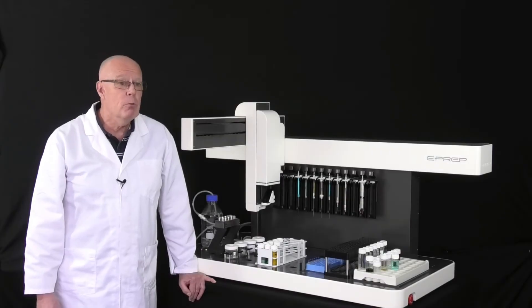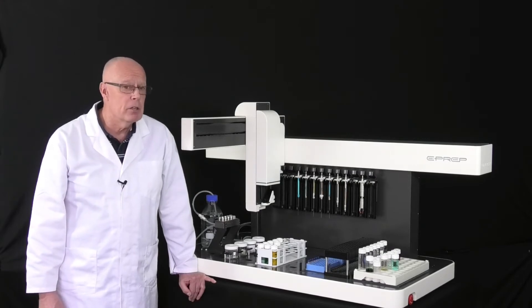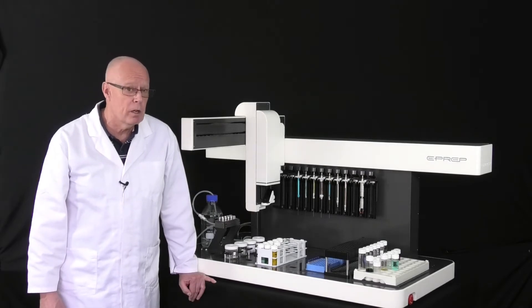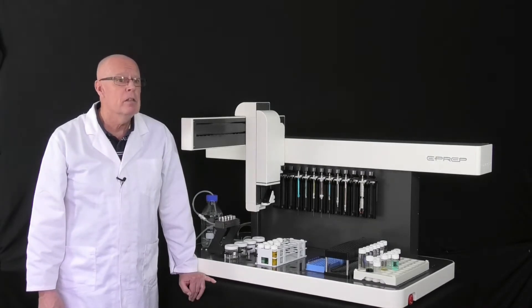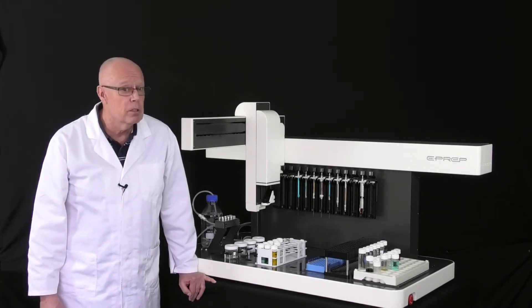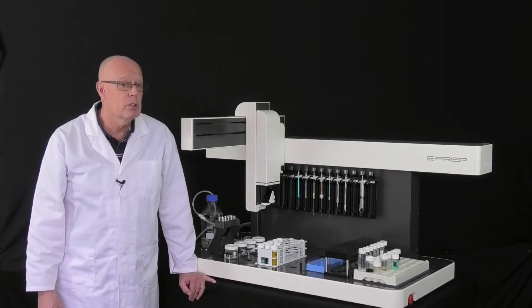If we, for a minute, look at some aspects of lab operation through the eyes of a lab manager — the lab manager wants to have their staff utilised in the best possible way. Any job should be carried out by someone suitably trained, not undertrained, not overtrained. So we have designed the E-PREP workstation and software to match these requirements.